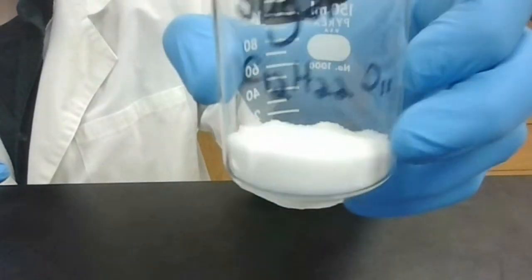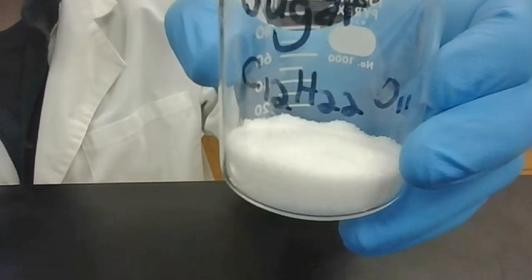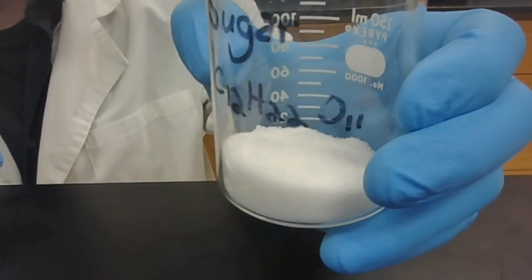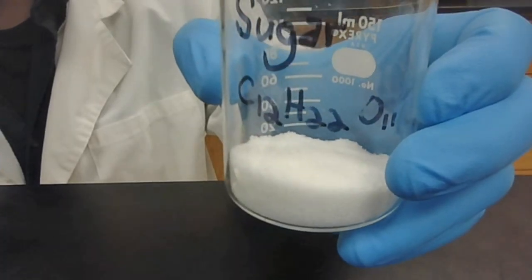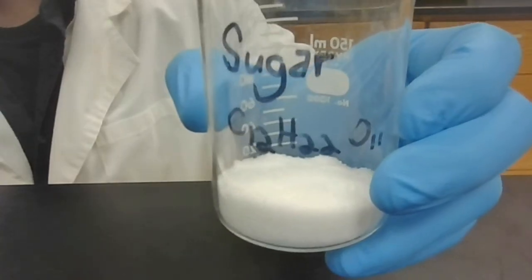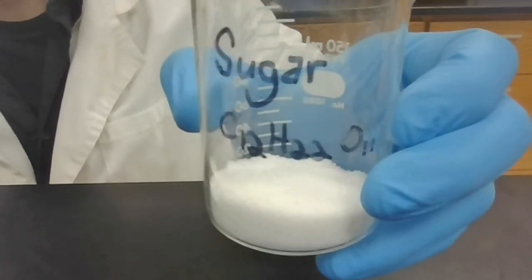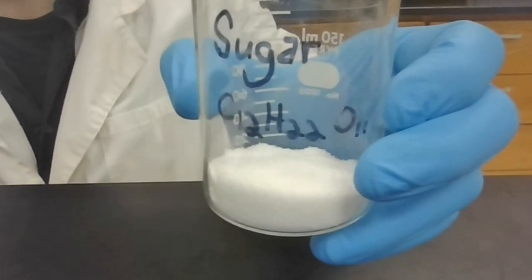For the next sample, we are going to use sugar. First thing to clean off the Crisco. So sugar, the chemical formula, contains carbon, hydrogen, and oxygen. Remember, for compounds with multiple elements, more than 2, choose the highest electronegativity and the lowest electronegativity when determining bond type. Go ahead and determine bond type now.